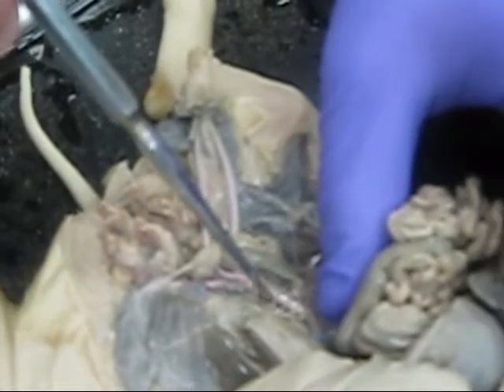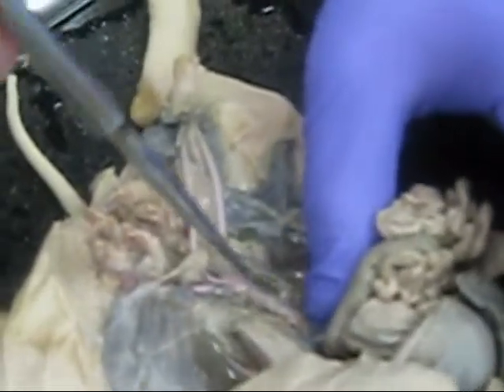All right, turn page. Oh wait, no, don't turn page, you're on the other side. All right, let's try and get the lower half of the body. Right here we have the, what's this thing called? Oh yeah, this is the lower aorta, posterior aorta. Going past the diaphragm, we have the... where is it? Right there. Going into the massive tissue is the coeliac artery. And then the anterior mesenteric artery, I don't see that one.